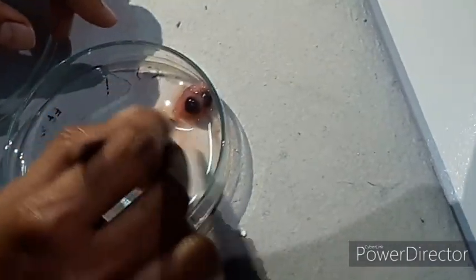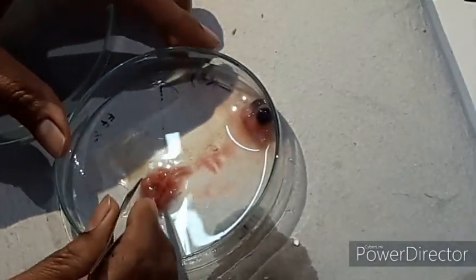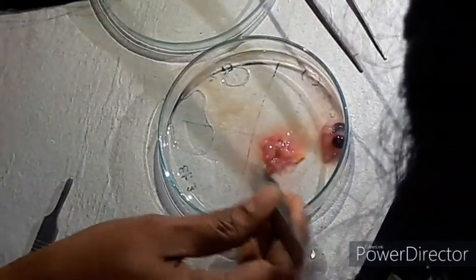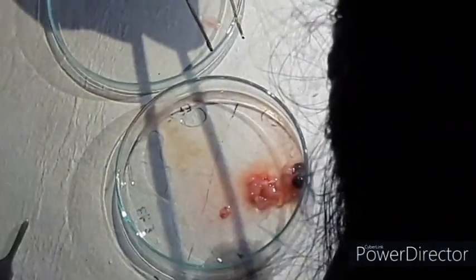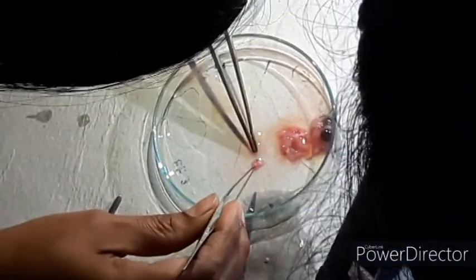The head is separated and the limbs are separated from the embryo. We probe into the anterior half and what we see is the heart of the embryo. The heart is transferred to a separate sterile petri dish containing PBS.